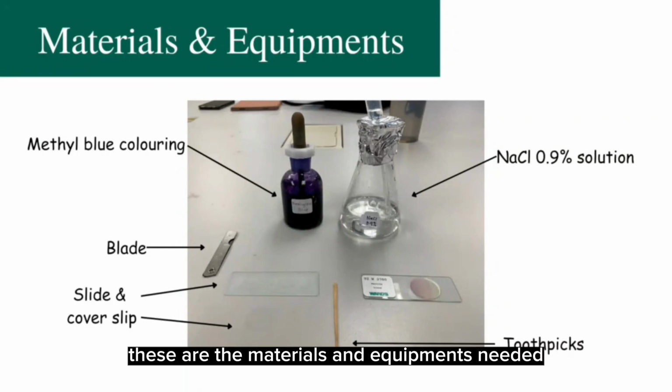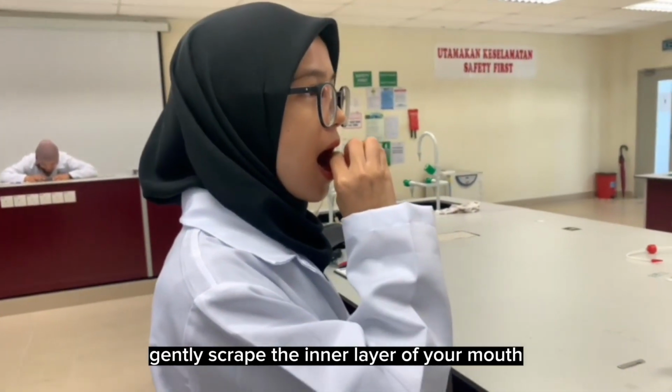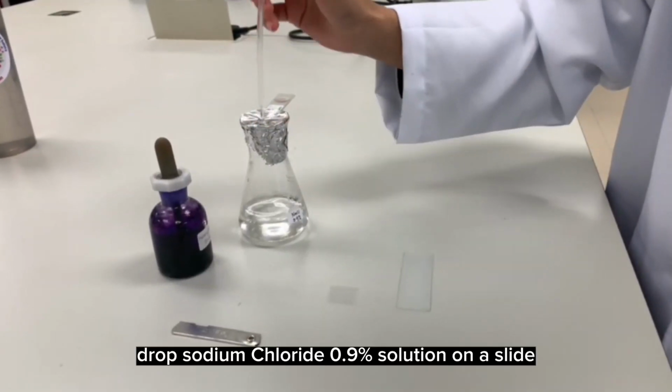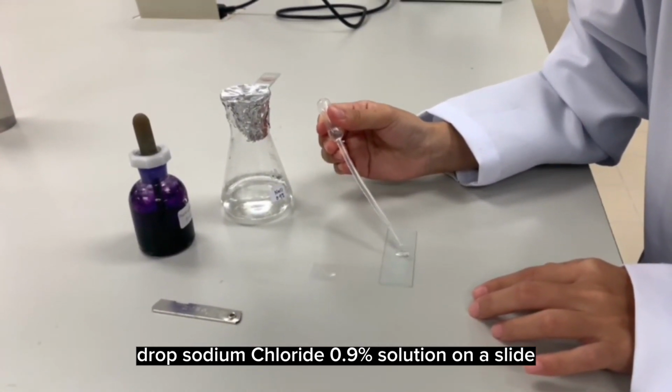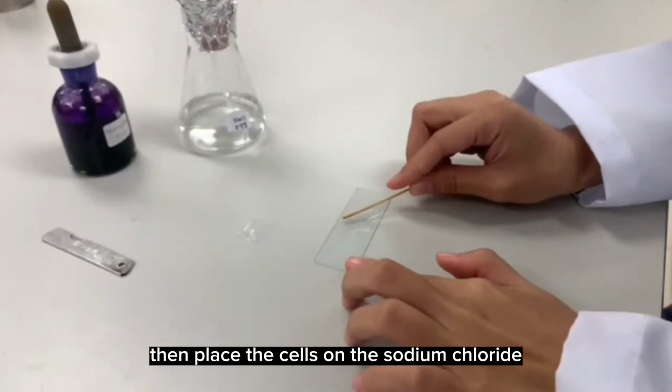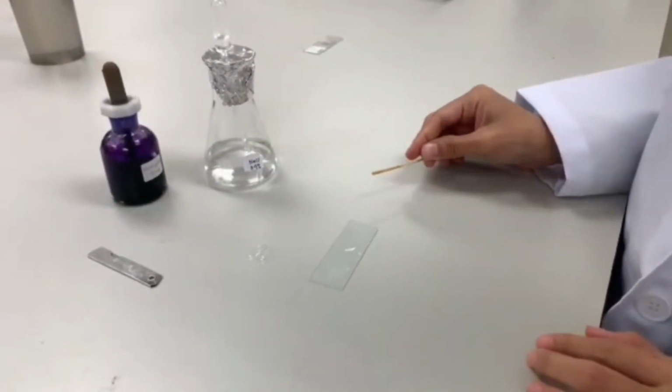These are the materials and equipment needed. Using a toothpick, gently scrape the inner layer of your mouth. Drop sodium chloride 0.9% solution on a slide. Then, place the cells on the sodium chloride 0.9% solution.